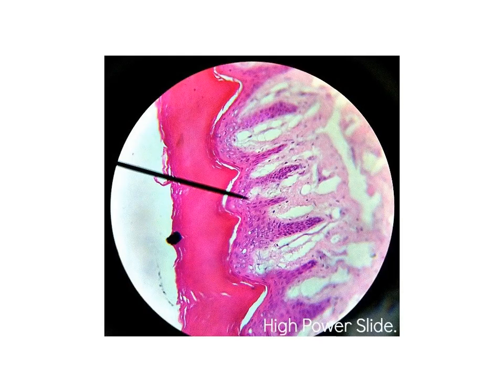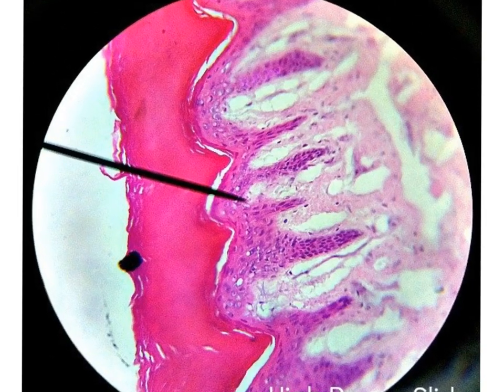This is another picture for another type of epithelium. Here you can see the multiple layers of the nuclei, so it is a stratified epithelium. And the top layer here, you can see the flat nuclei. Perhaps it is not very evident, but we have a very characteristic layer of red stained keratin. So it is a stratified squamous keratinized.